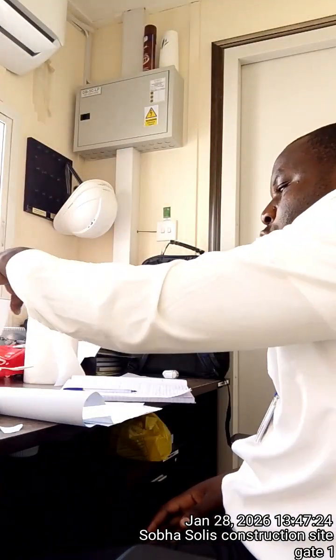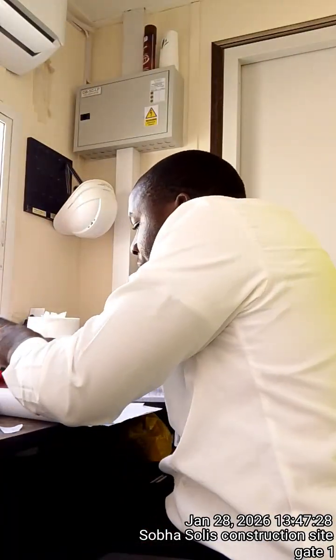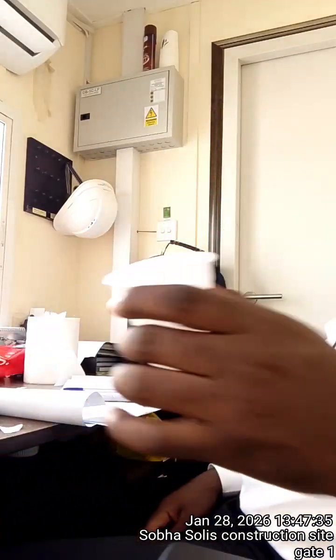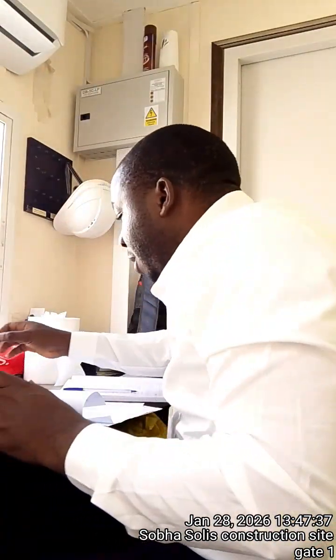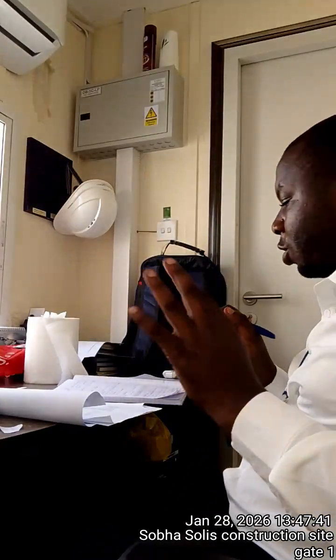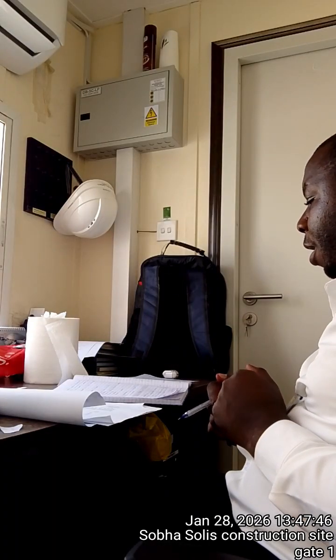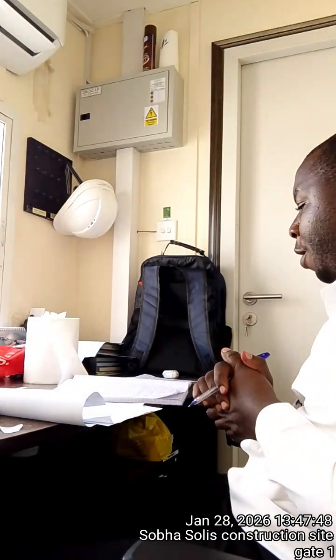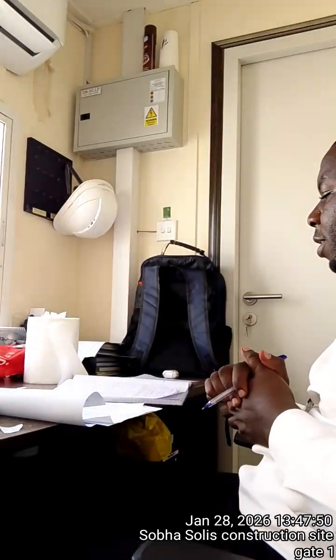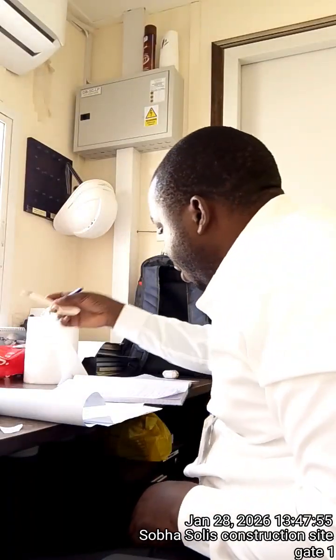Another one. So members, after realizing that the pH of my water is almost the same, I decided to use one sample. So this time I'm only going to use the tap water. We have to minimize the usage of resources and utilize them properly. In this case, I'm going to be testing for carbonate ions using sodium bicarbonate, and I'll need the following.